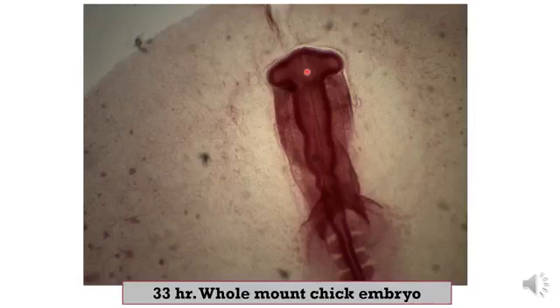And this is the telencephalon, diencephalon, and you can see the optic vesicles from the diencephalon, and mesencephalon, rhombencephalic isthmus, metencephalon, and these are the neuromeres of the myelencephalon. Neuromeres.